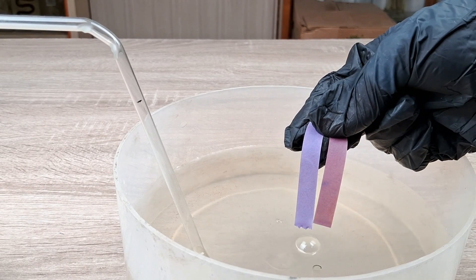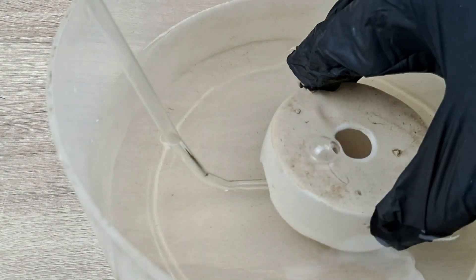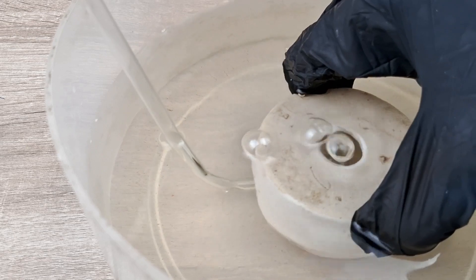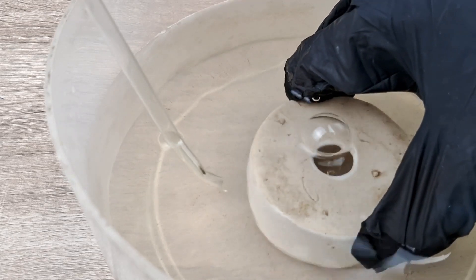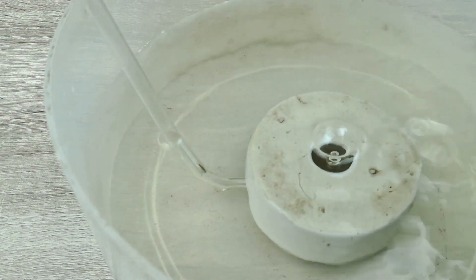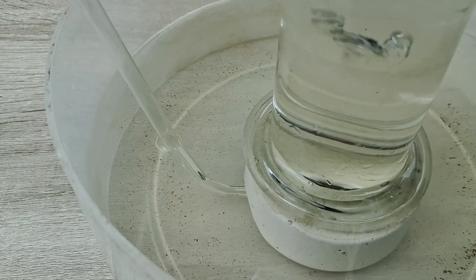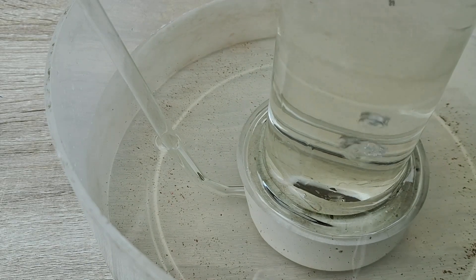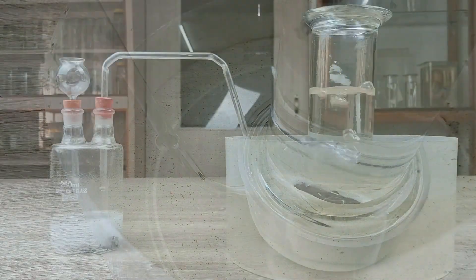Next, place the beehive shelf over the delivery tube immersed in the water, and then place the gas jar filled with water upside down on top of the beehive shelf. You can also use a large test tube instead of a gas jar. Allow the gas to completely fill the jar.